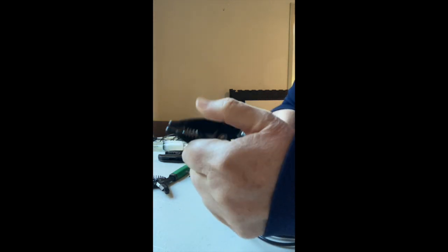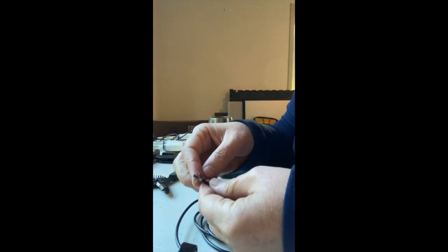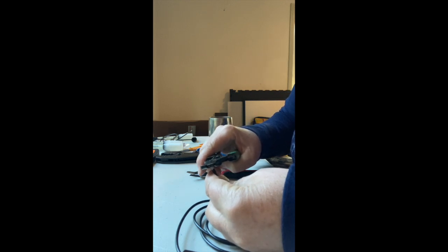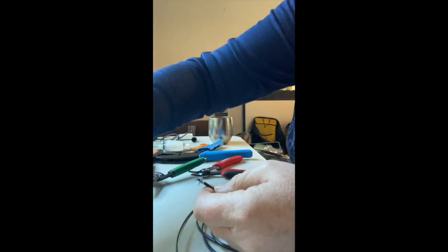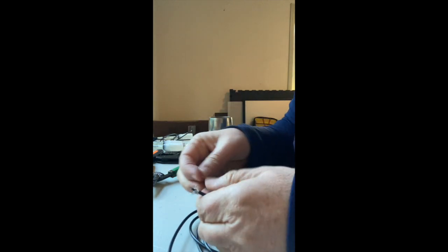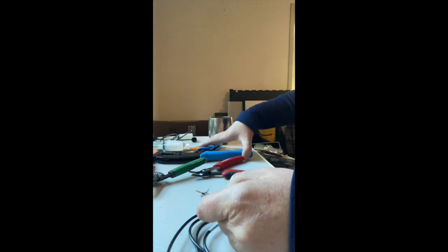Usually I cut it with the 12 and then strip it with a larger one. Seems a little easier. And there's the outer ground wires and the inner conducting wire. And the inner conducting is size 26. And I cut that about 3 millimeters. A little bit goes in the pin. Crimps on the smallest for my crimper.